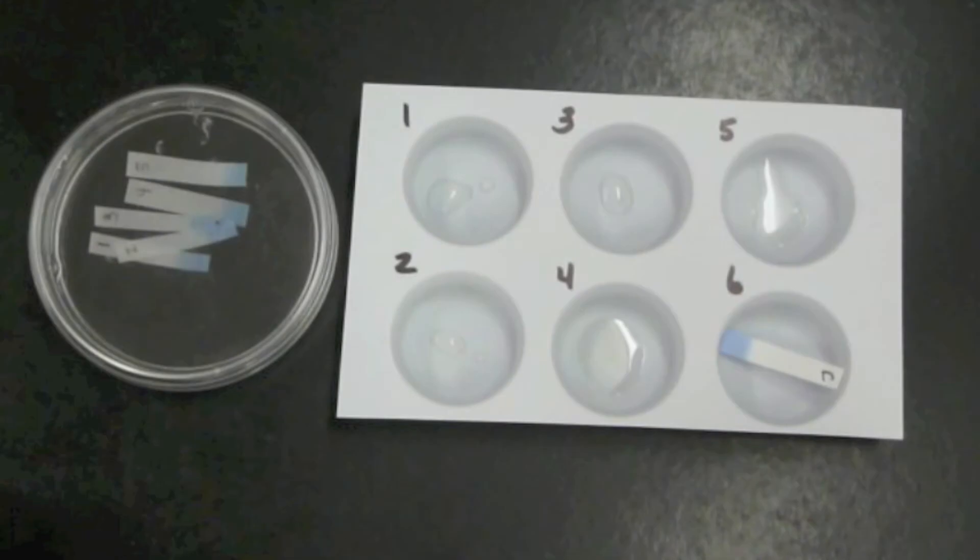We'll need to let these sit for about ten minutes to develop. Now we'll watch a time lapse video of the next ten minutes.